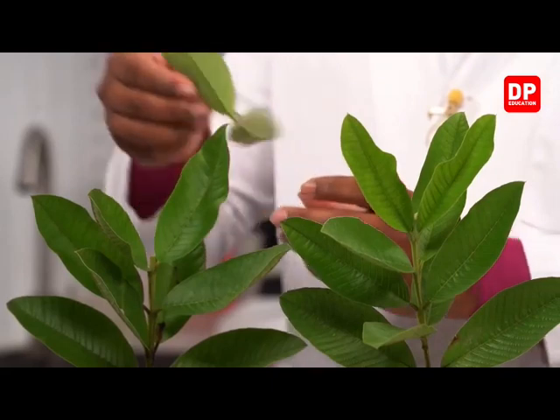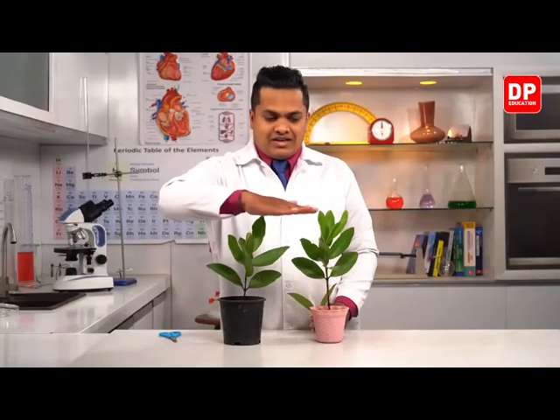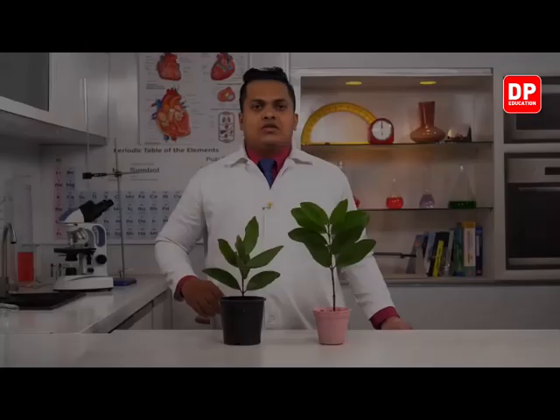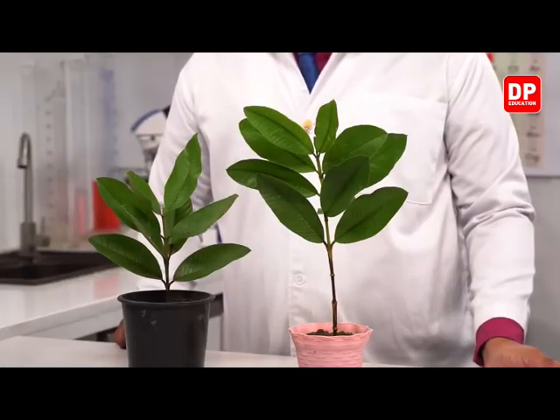Okay, so it was in this kind of position, right? So this plant is similar to the height of the other plant. Now what we are going to do is check this system after a week or two, and let's see what has happened with the system. So my dear children, now this is our result. I have kept this system for about 2 weeks. Now you can clearly observe what has happened with the system.